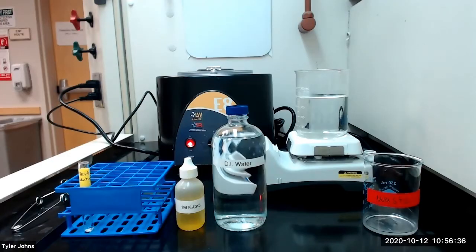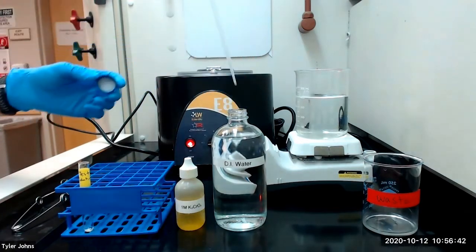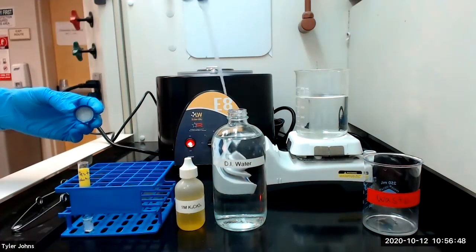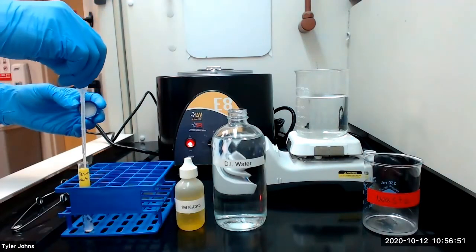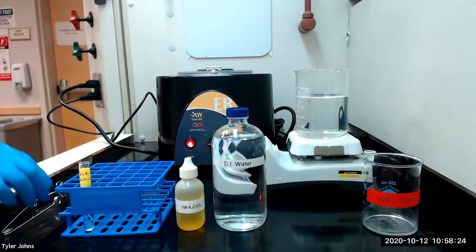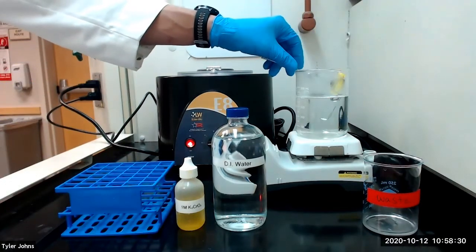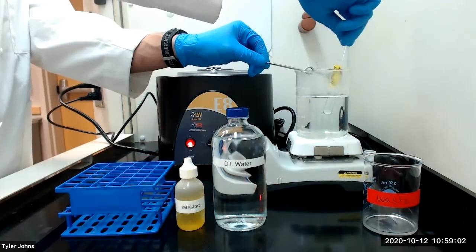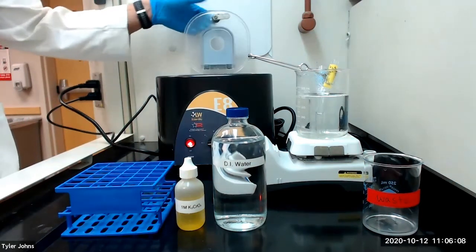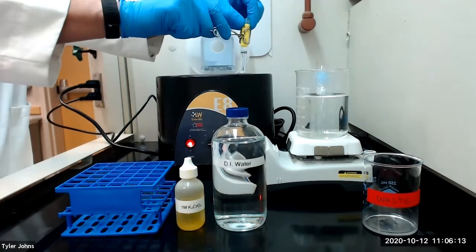We will now perform our test for lead ion. We're first going to add three milliliters of deionized water to our test tube with residue R1. We will heat our mixture to near boiling in a hot water bath while stirring. After heating our mixture to near boiling, we need to remove the test tube from the hot water bath and centrifuge our mixture.